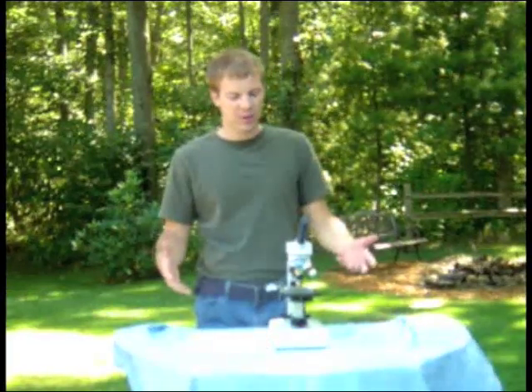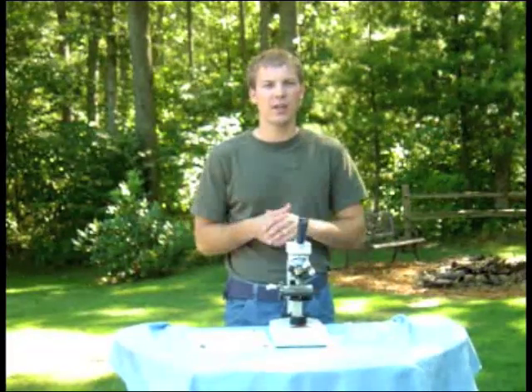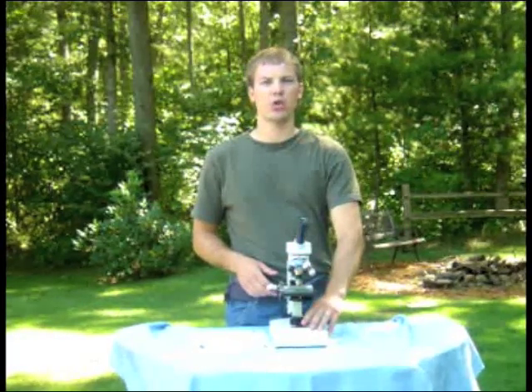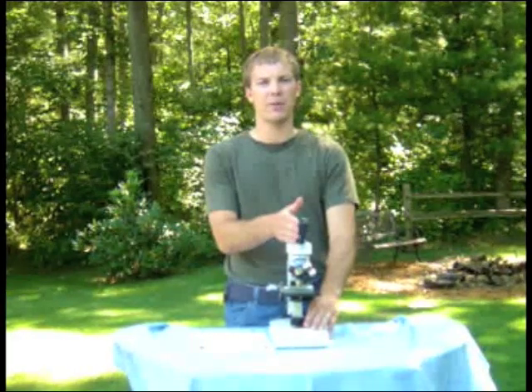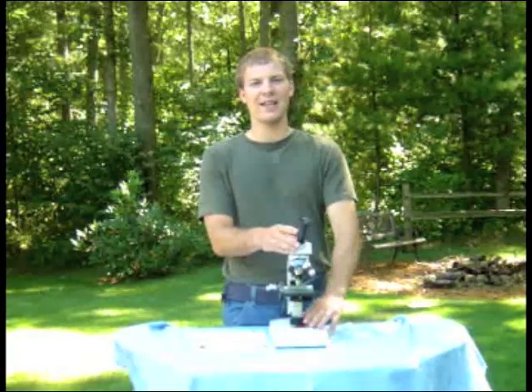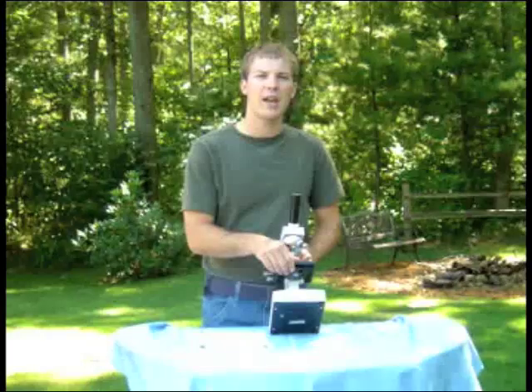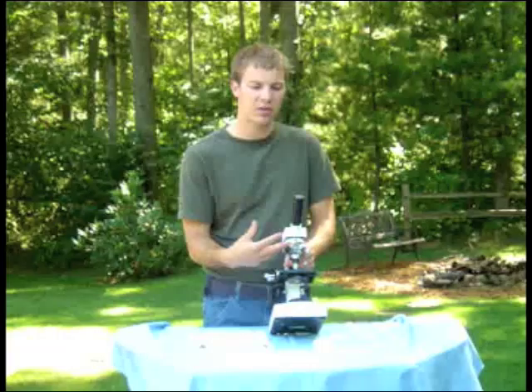The symptom is you look into your eyepiece and everything is black. Here are some possible reasons for that. First of all, make sure the light is turned on — if it's not turned on, you won't see anything through your eyepiece. Secondly, if you look through and it's still black and the light is on, make sure you adjust your diaphragm so that it's clicked into one of the circles, allowing light to shine through into the stage.